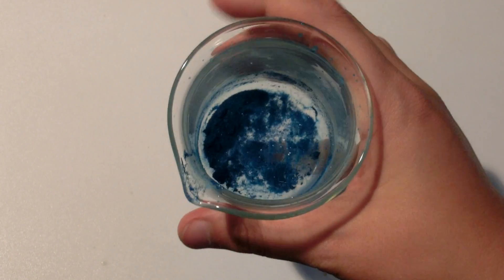After drying, this is my final yield. It's a sort of dark blue greeny color. It's very pretty.